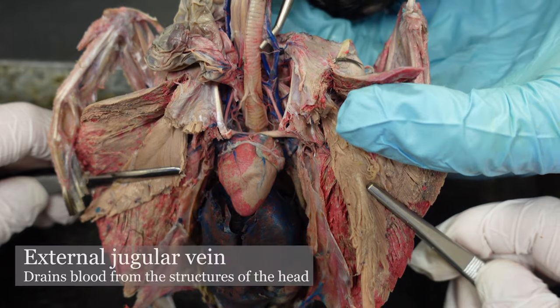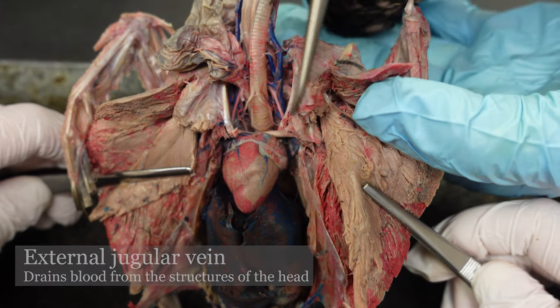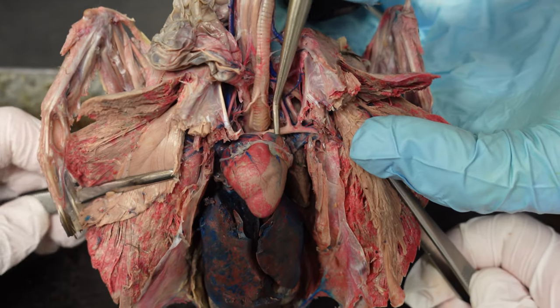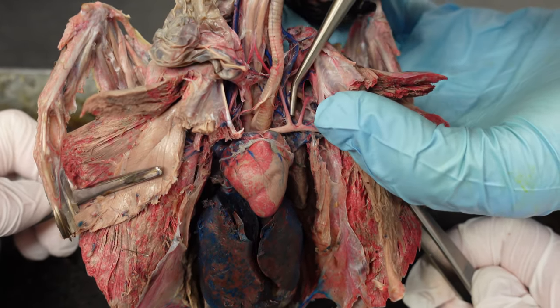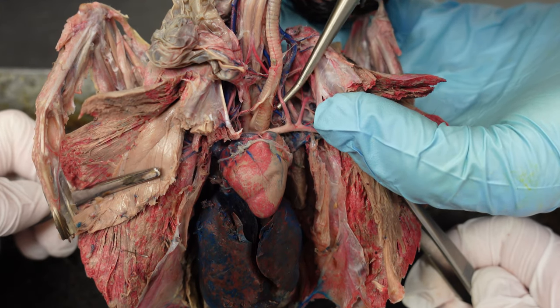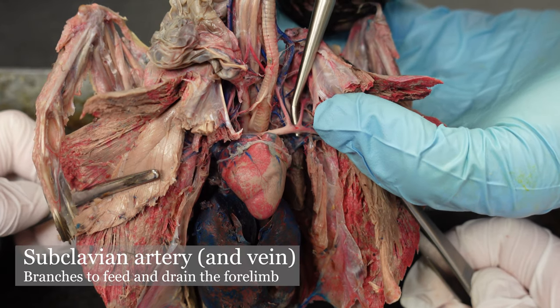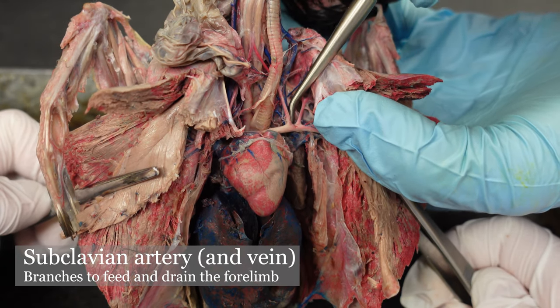The other one to know is the external jugular vein. Back down to that juncture where the common carotid joins up with the brachiocephalic artery — now that we've passed the common carotid, the head-directed blood vessel, this is now the subclavian artery. And below that we have a subclavian vein.